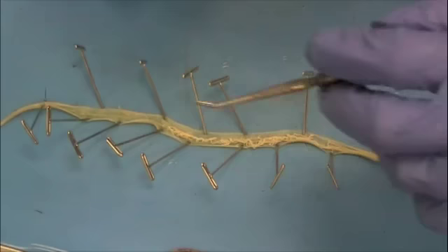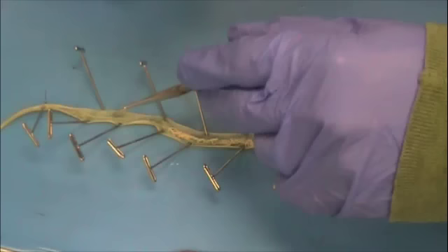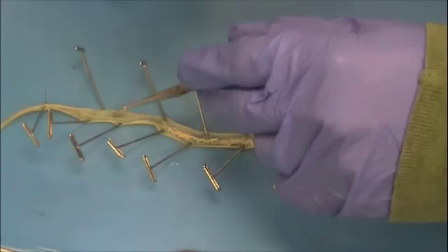The tube that you see up at the anterior end here is the digestive tract, the gut. However, the Ascaris does not need to digest its food because it lives in the intestines of a host. The food is already digested, so it simply opens its mouth and then absorbs the nutrients from the host.